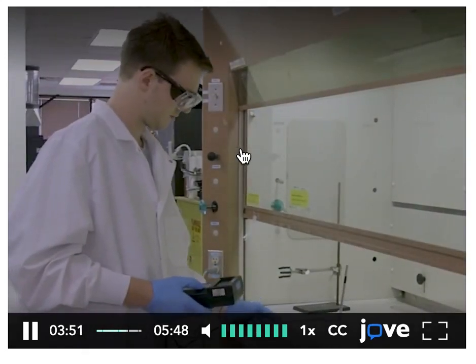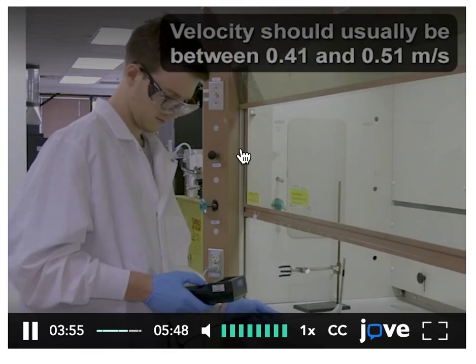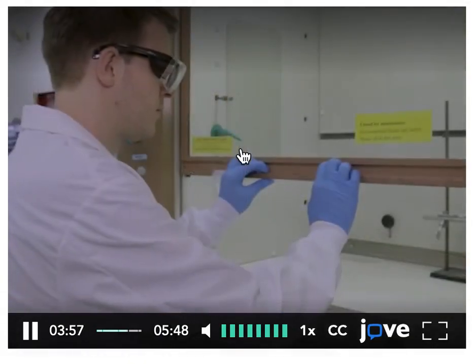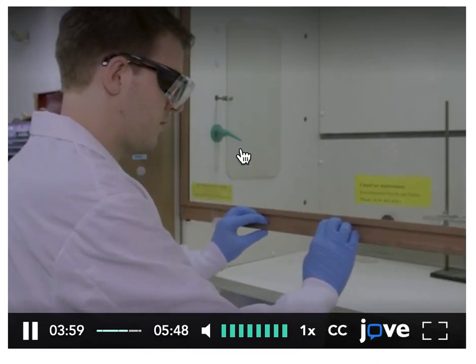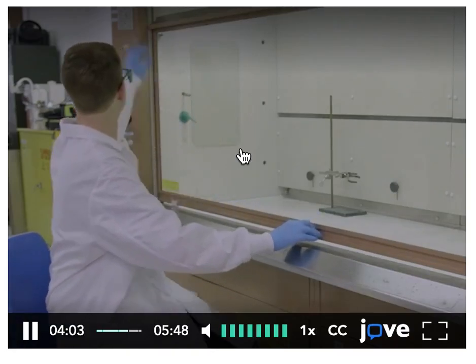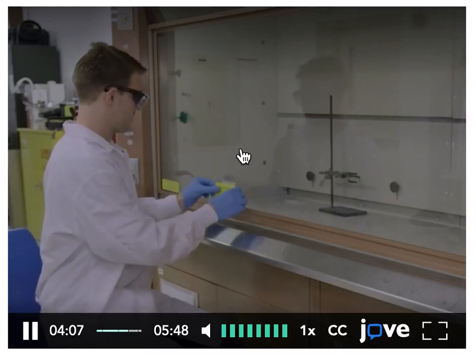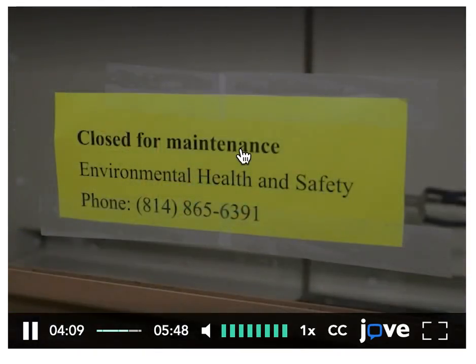Perform regular maintenance by testing alarms and flow velocity at the maximum sash height. If the velocity is low, lower the sash until it is at the required speed. If the sash becomes too low for work to be done at the hood, cease operations until the root of the problem is addressed.